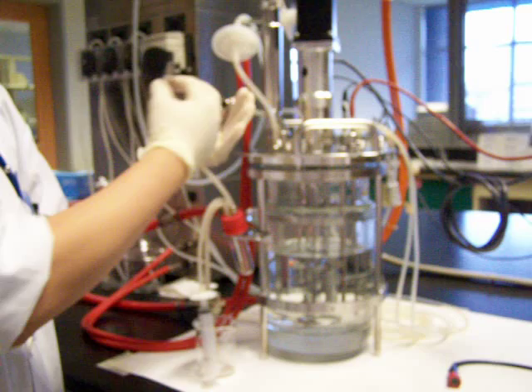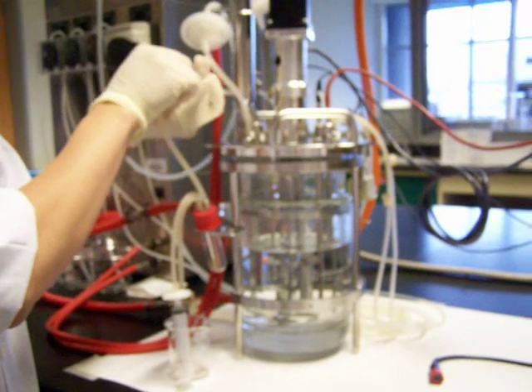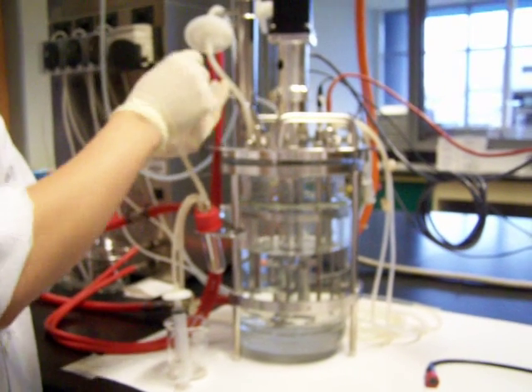This female coupling, male coupling, has a rubber septum inside. So when you withdraw it, it will seal up.